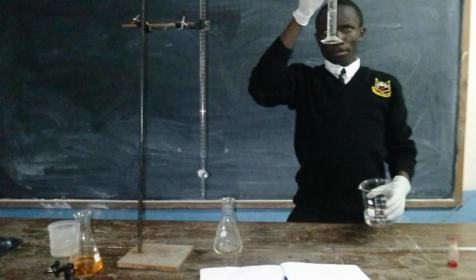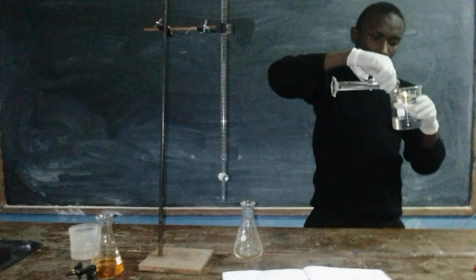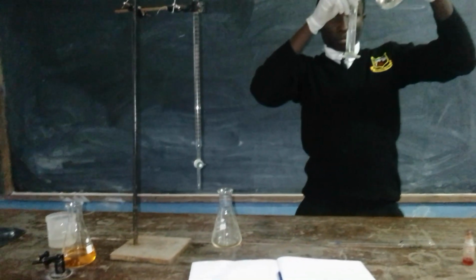Hello guys, welcome back to my studio, and we are proceeding with our normal titration series. This one is now titration number 10, practical 10. So we are in my studio.